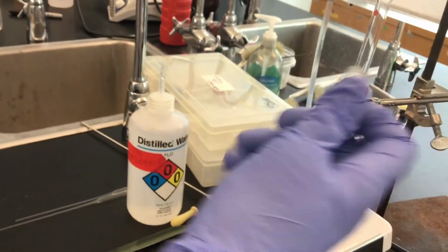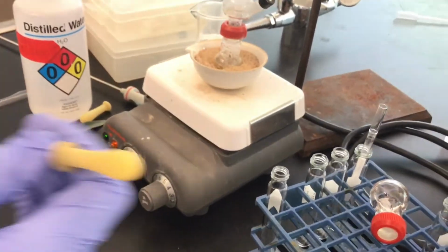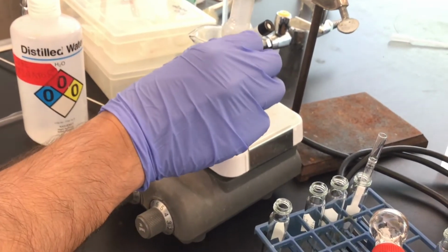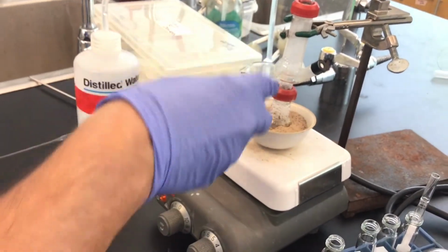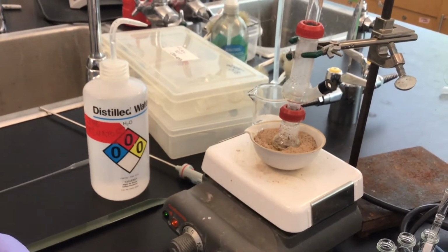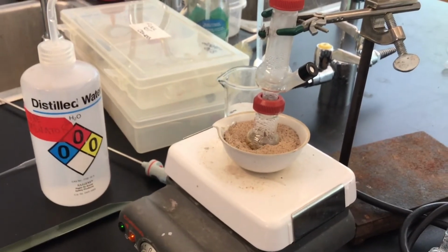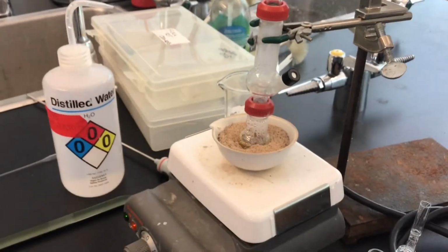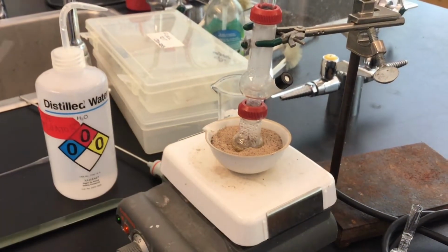So we're just going to wait, and then what I've got here is my test tube rack, and here's my culture tube where I had the 6 milliliters marked. And what I'm going to do is take out the distillate and transfer it into there. And every time I take a little bit out, I'm going to use a separate Pasteur pipette to add more water down into the distillation pot, okay? And I'm going to want to aim it down the center so that it, of course, doesn't pool with the distillate itself, because then you're just collecting too much pure water again. But we'll emphasize that again shortly. So we see that it's collecting, we just have to wait a little bit.